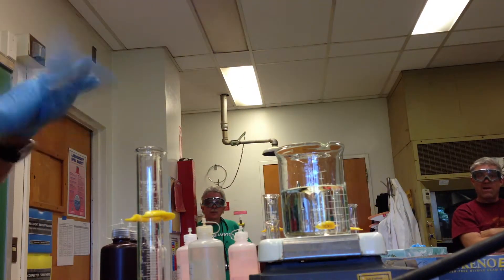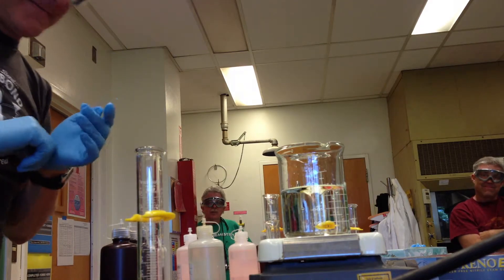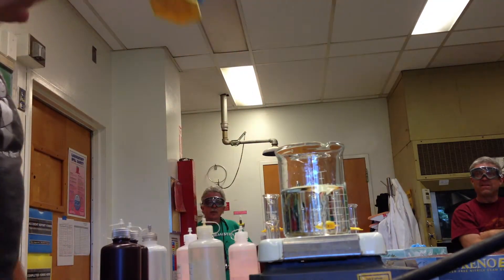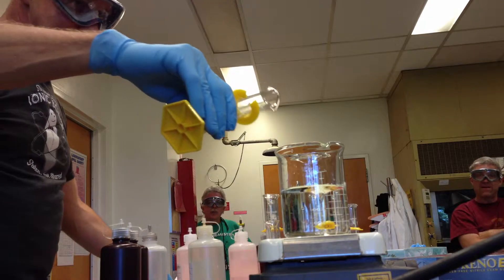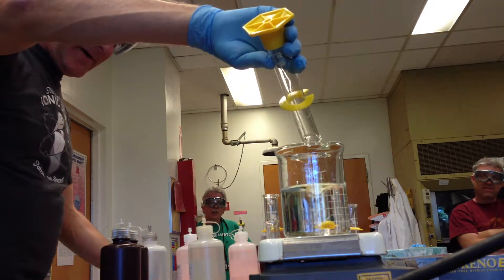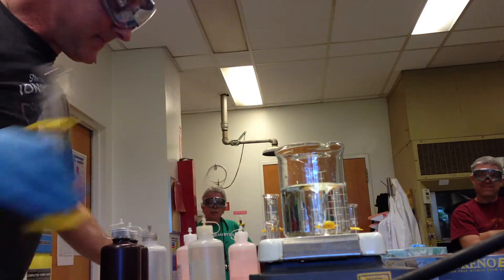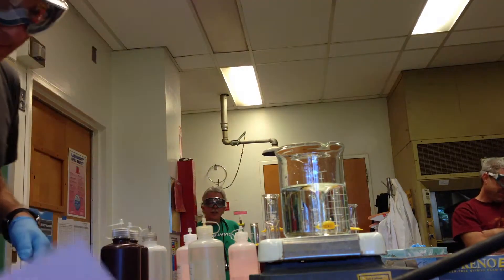And there you have it. Silver nitrate added to water. What are we going to get? Silver nitrate in water. Yes. I got that one right now. Excellent.